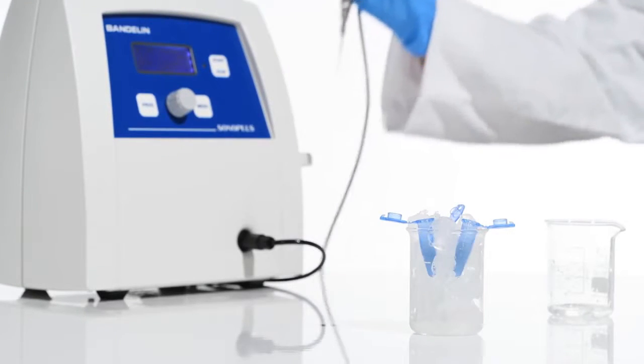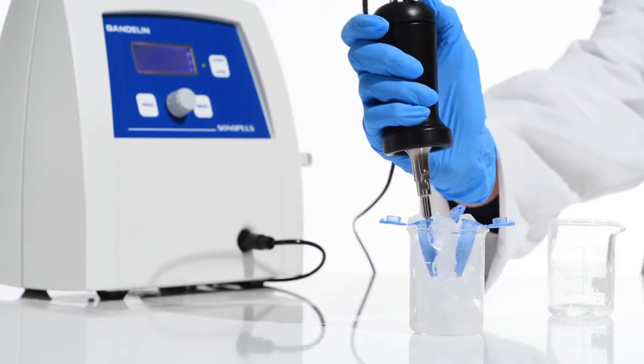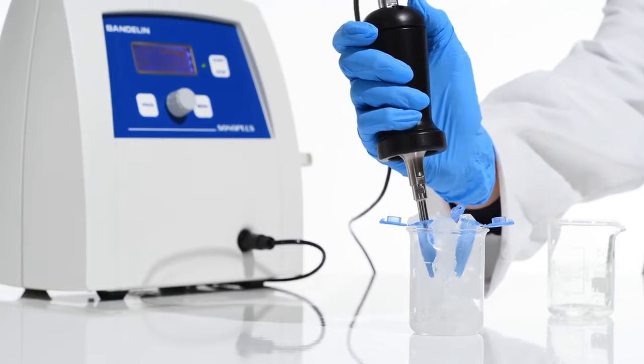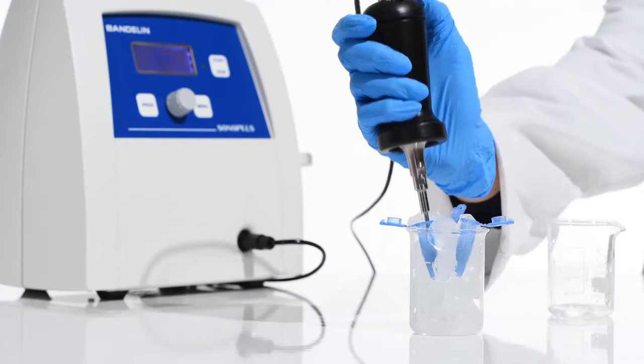Sonication can be carried out by hand or with the use of a stand. If necessary, the sample can be cooled in an ice bath during sonication.